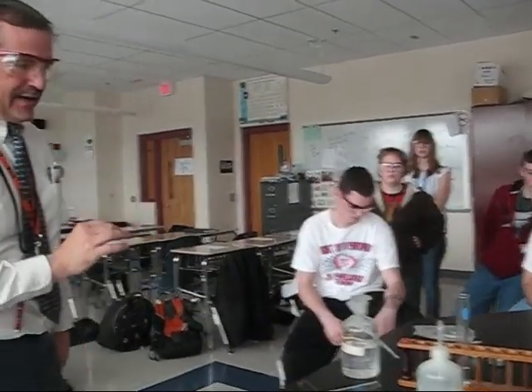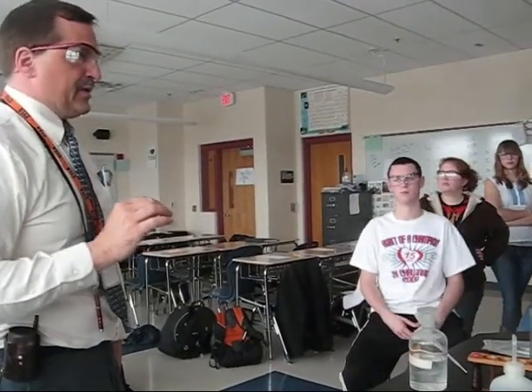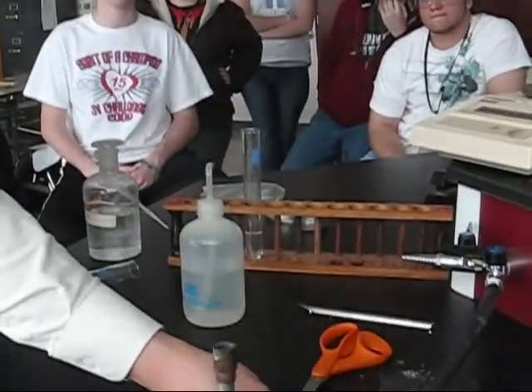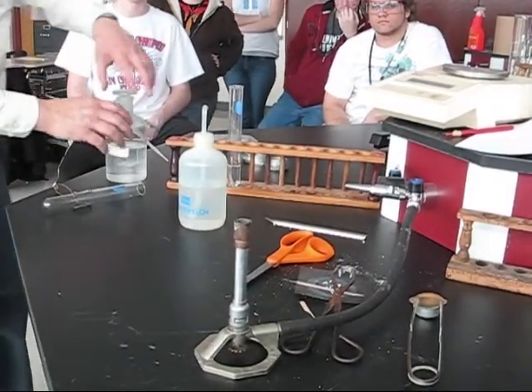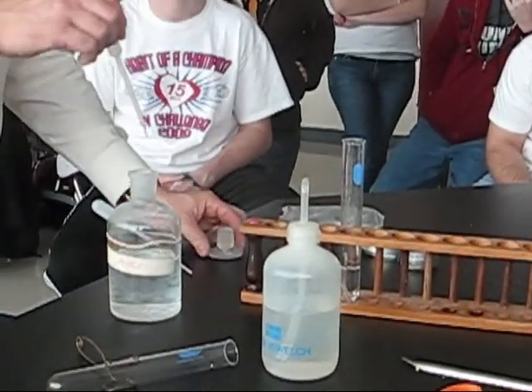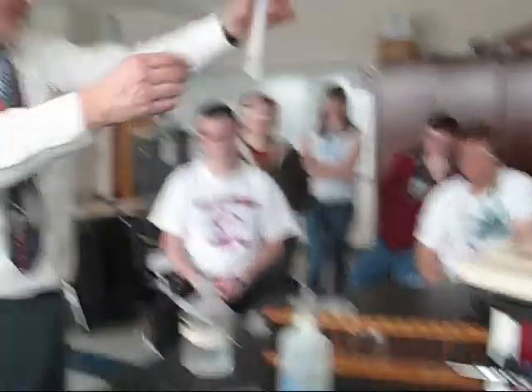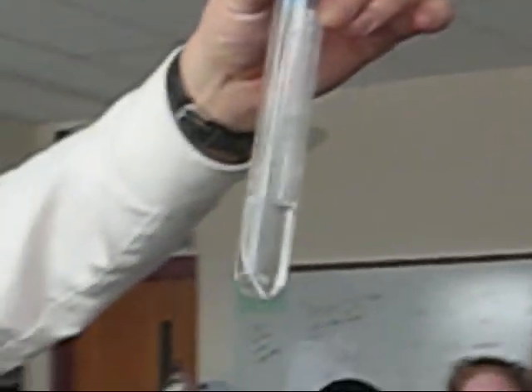We can increase the rate of reaction by adding an acid. An acid reacts violently with magnesium. Here's some six molar hydrochloric acid — it's about half strength. I can go ahead and put a few drops in and all of a sudden we'll see a reaction beginning. There are some bubbles going on there — a gas is being released.